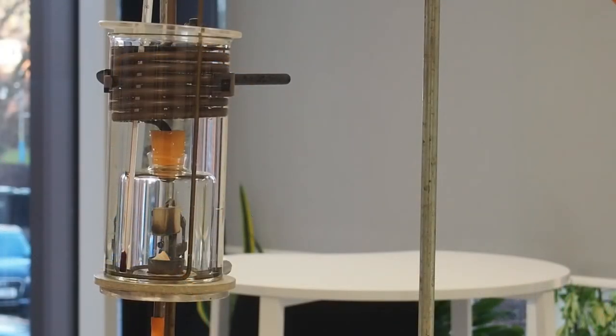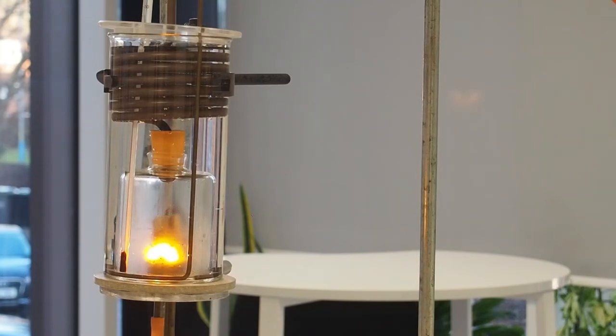Right, so it's starting to glow. I'm just going to bring it down in contact with the food and you can start to see, there it goes. And you'll notice it's burning very much brighter than what we observed before. And it will continue burning in the presence of 100% oxygen until all of the food source has completely combusted.